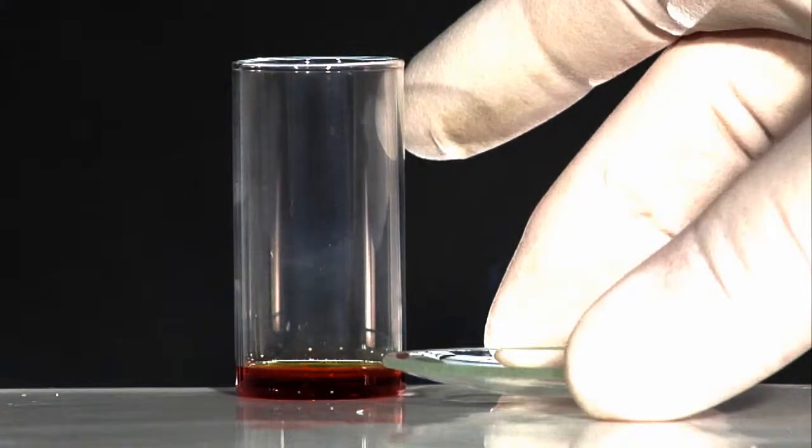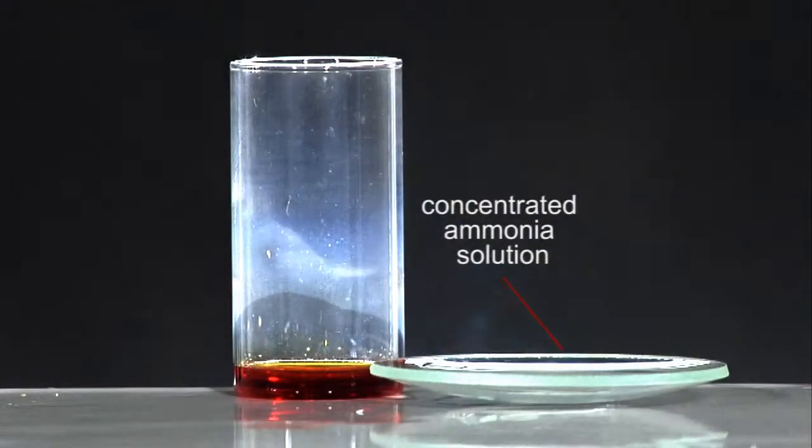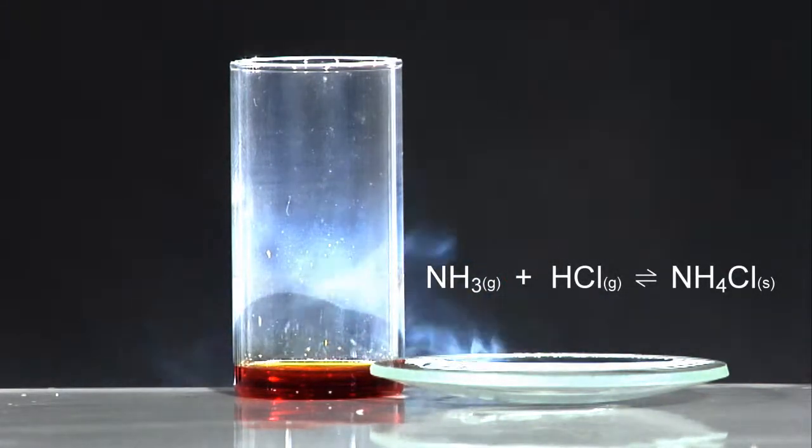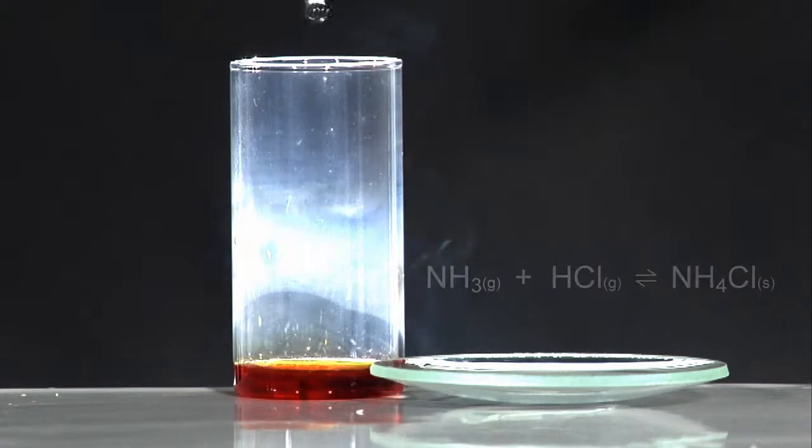These products include hydrogen chloride. Here, a concentrated solution of ammonia is used to show the presence of hydrogen chloride gas produced by the hydrolysis reaction.